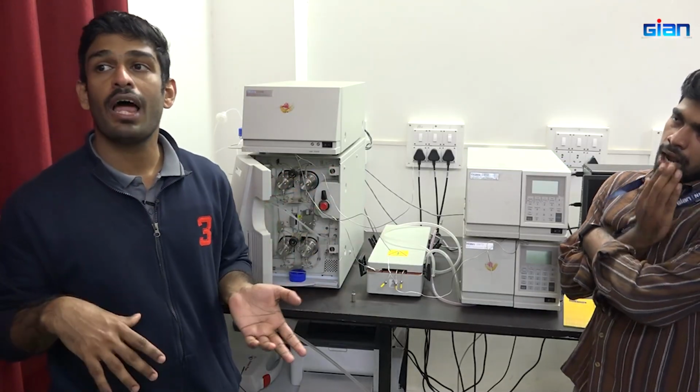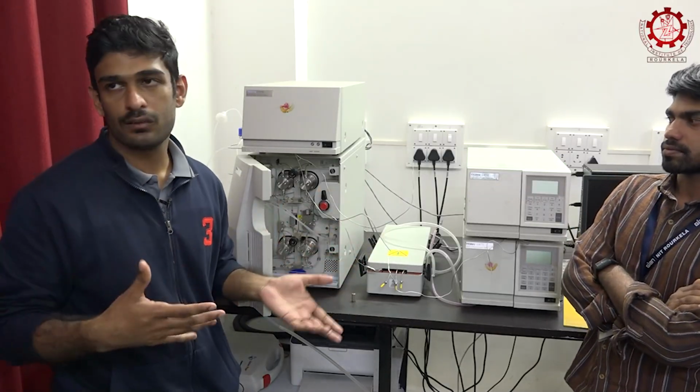Can we use a mixture of solvents or only a single solvent? Mixture of solvents in the sense, depending upon the polarity. You are talking about the mobile phase, right? Yes. Okay, we can use a mixture of solvents or a single solvent itself.